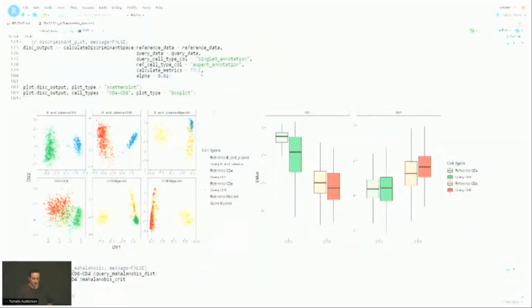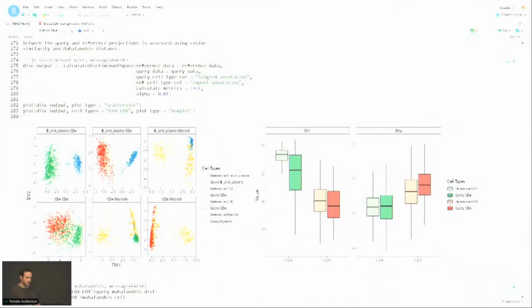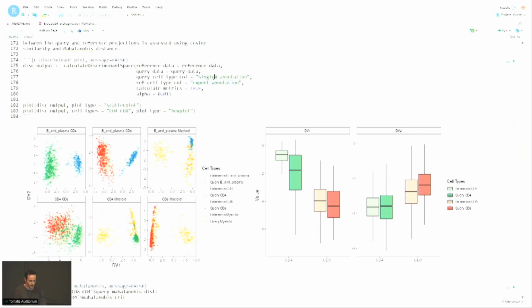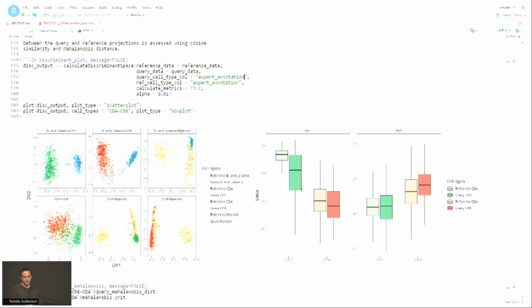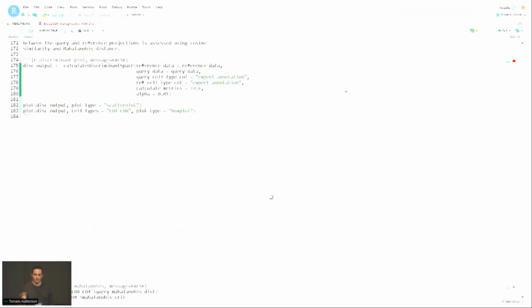So this is the plot that was shown in the slides, and as you can notice, things are not particularly well aligned based on the input. And if you notice here for the query, we actually used the SingleR annotation. Just as an example, if I switch from the SingleR annotation to the expert annotation and rerun this, this is just a box plot showing the reference in the light color and the query in the dark color. If I run the code again with the expert annotation, you'll get the second picture we got in the slides, in which things were well aligned.